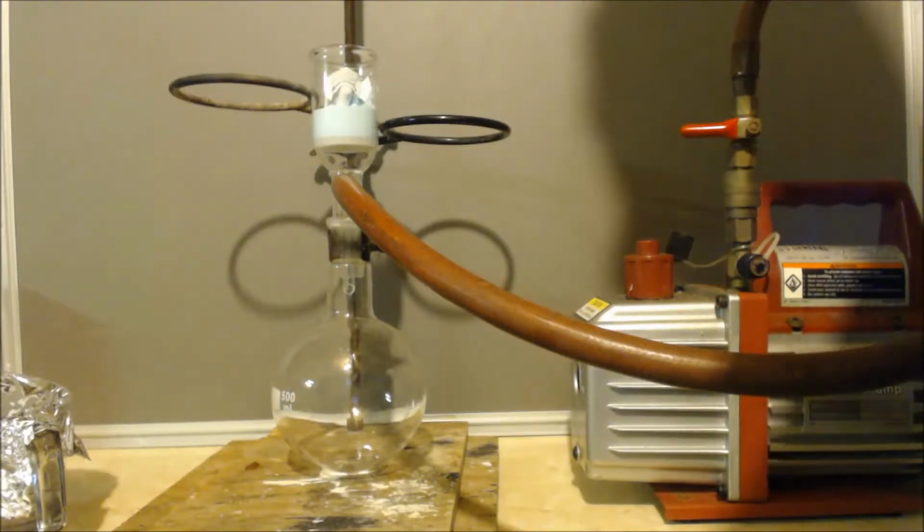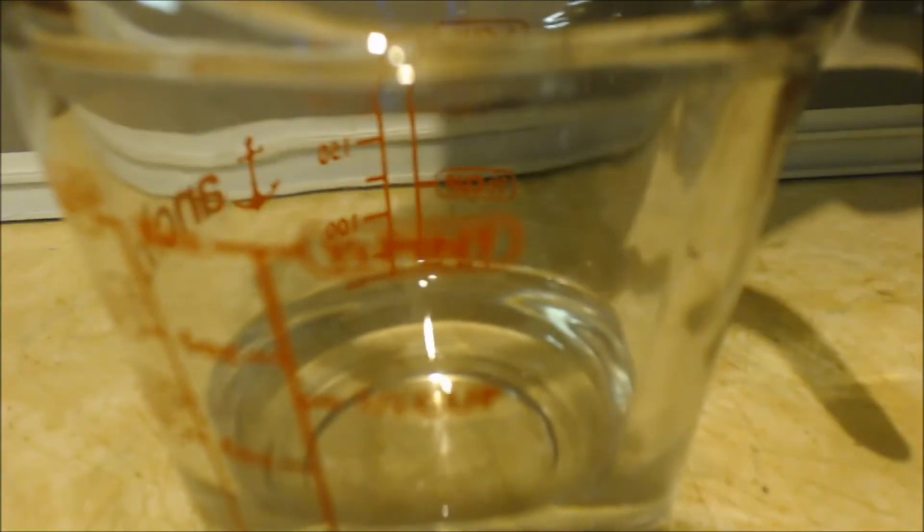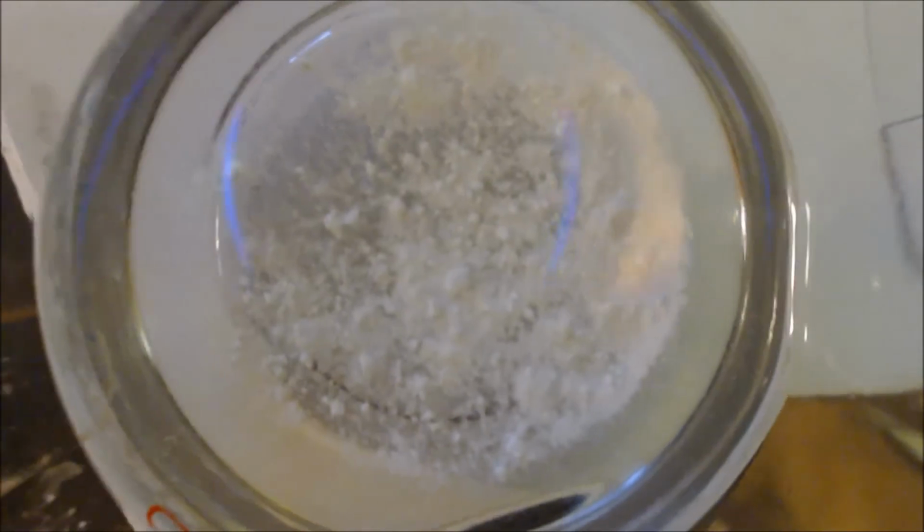Let's do a little test with it. So I'm going to throw some anhydrous copper sulfate in there. You can see, but see how white that is? I mean, that's white. Now I'm going to stir it up for about 20 minutes and see what happens with it. You can see, I let it settle back down. It's still white as can be. I mean, there's no blue in there. See how white that is? You know that's anhydrous.